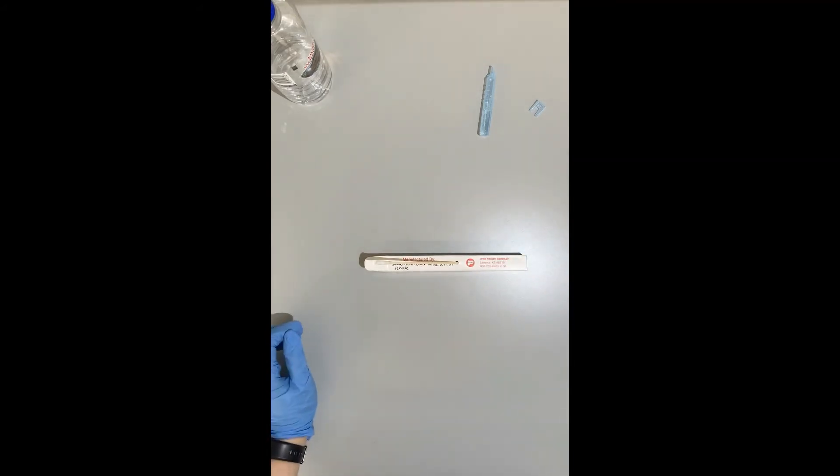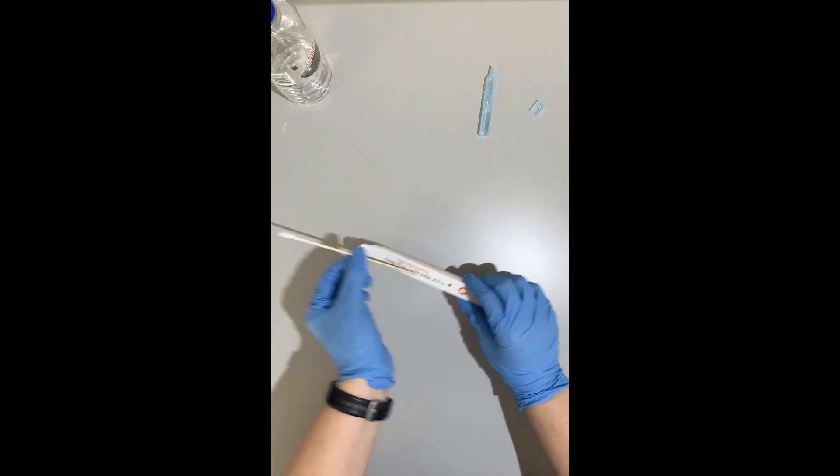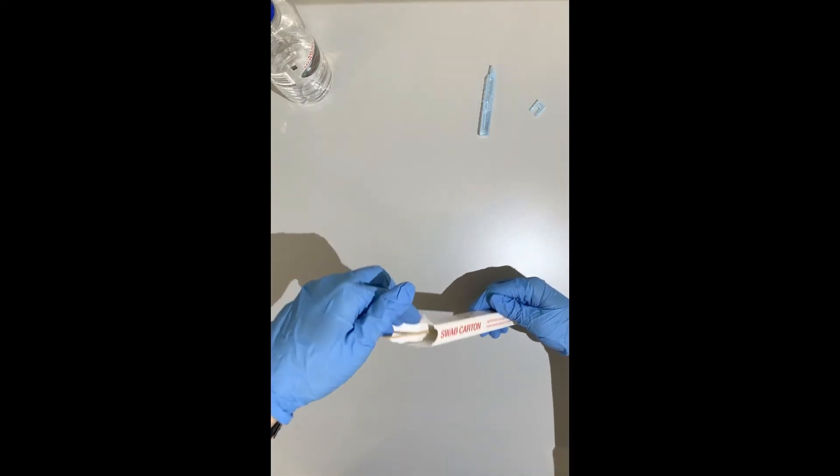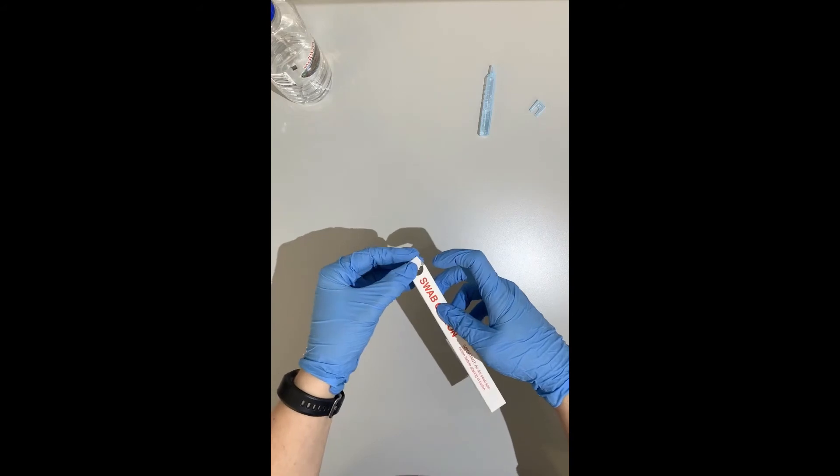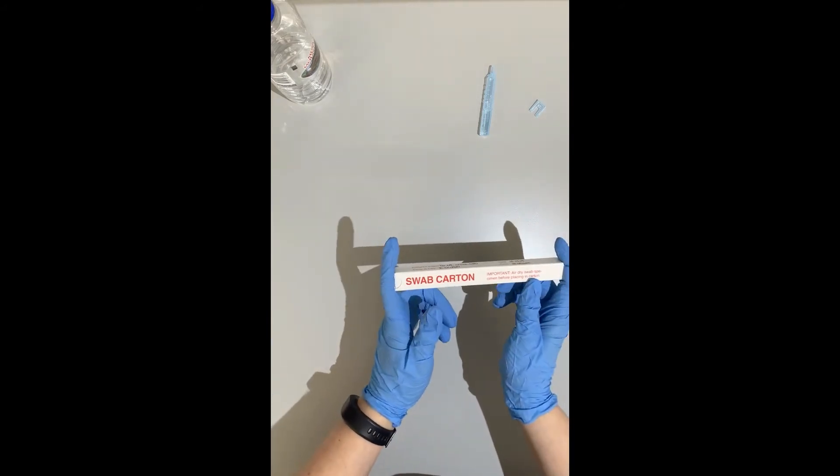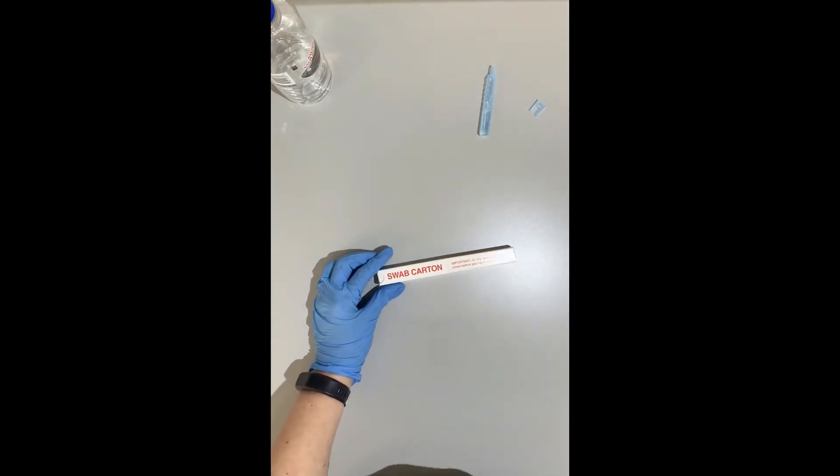We have magically waited. Our swab is now dry. I can place it inside my swab carton, close it up. You can either tape these ends down or you can leave them as they are because we're going to put this in another envelope, in another bag.